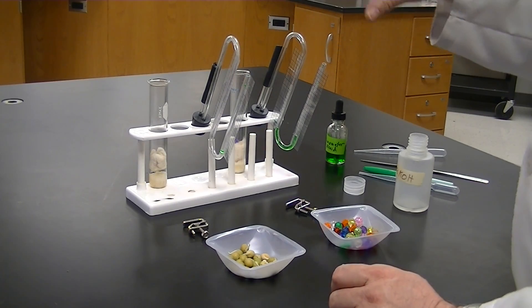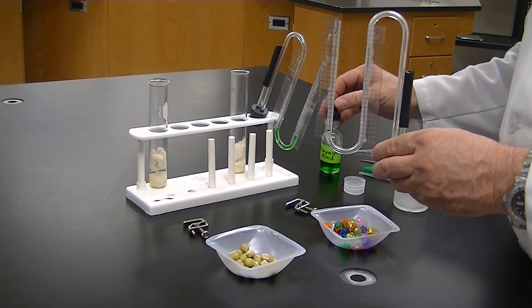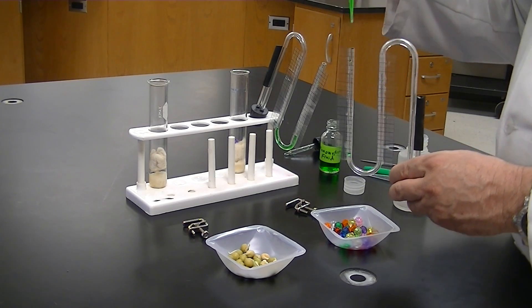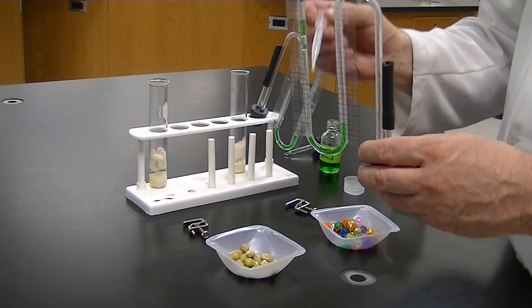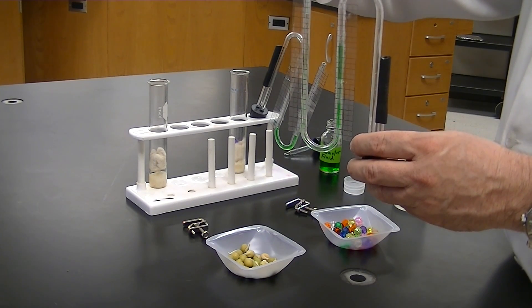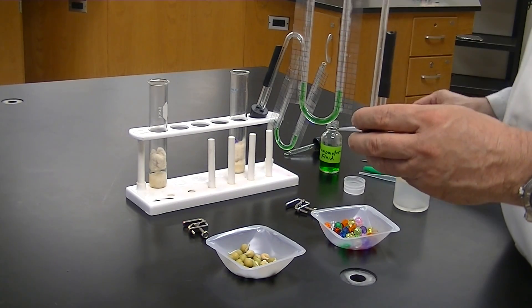Next, add fluid to the manometer or respirometer. I've already added it to the control tube and I'll add it to the experimental tube. I use a plastic pipette because it fits the inside diameter of the tube better. We need somewhere between a half and one milliliter of fluid. Make sure there are no air bubbles or fluid trapped up in the tube — push air up and down to move the fluid until all air bubbles are removed. We need enough fluid so it comes up around the U and up onto the graph paper grid.